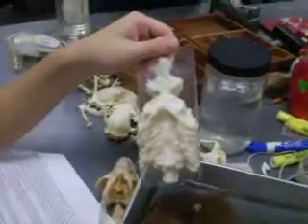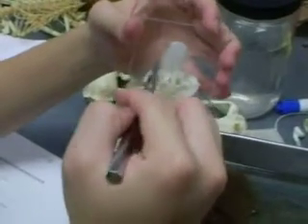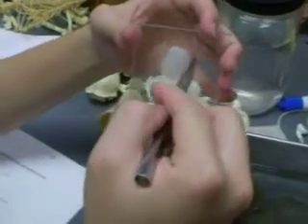Going from anterior to posterior: this is the rostrum — the nose of the shark. Directly attached to it, you'll find the nasal capsules, right here.